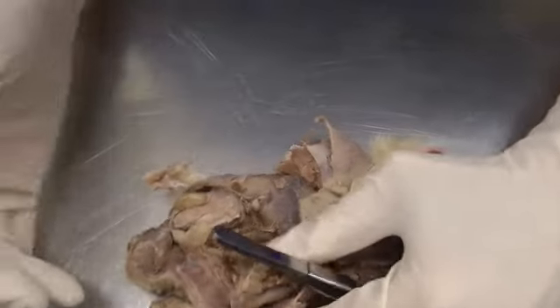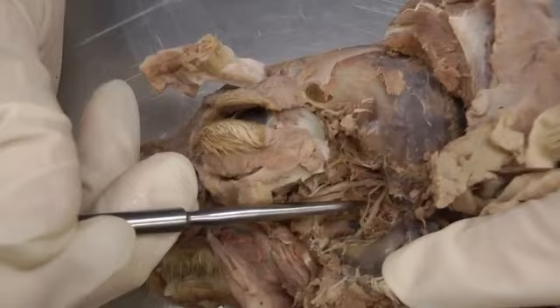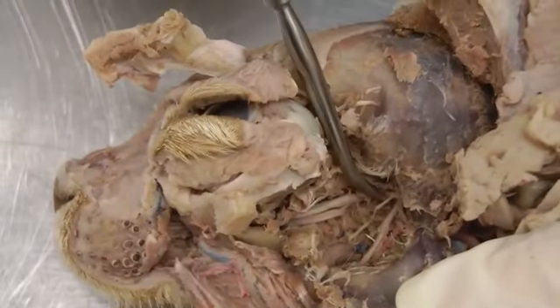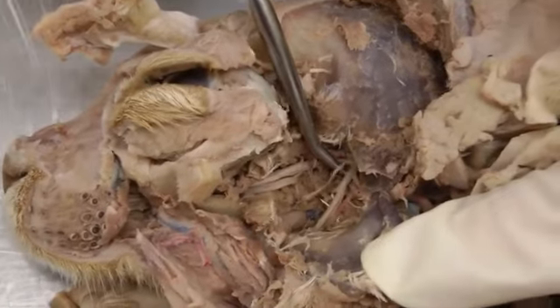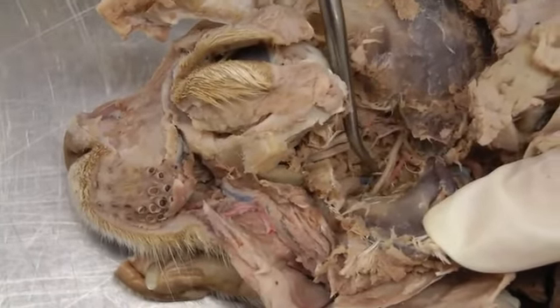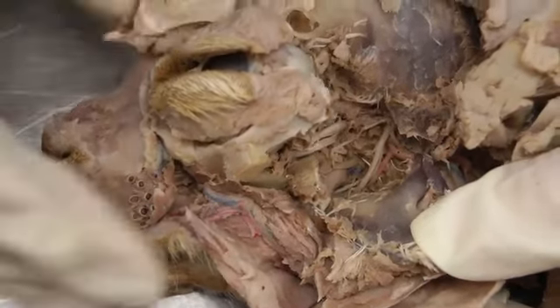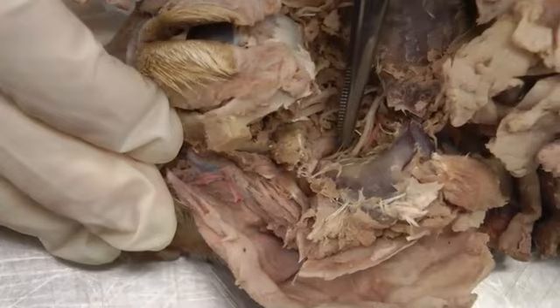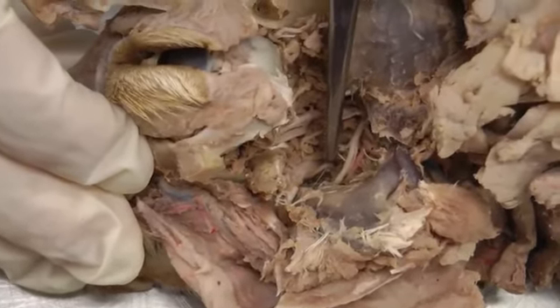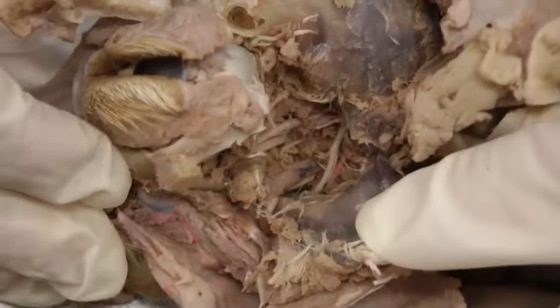And so here, you're looking in that deep dissection where we've removed the zygomatic arch, and you're looking right here for the mandibular nerve and its branches. Here again, the buccal nerve is broken, and actually our lingual is also broken. So it's right here. Lingual was that first, most rostral branch coming off here, and lingual goes to the tongue. That's the lingual nerve.